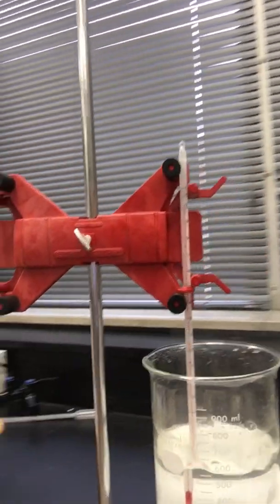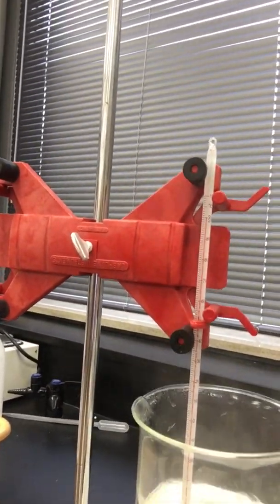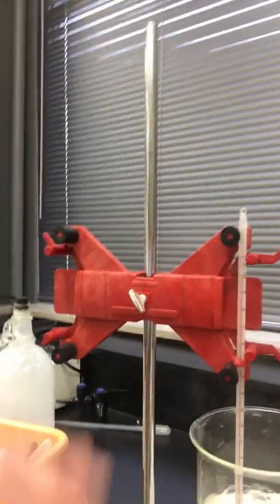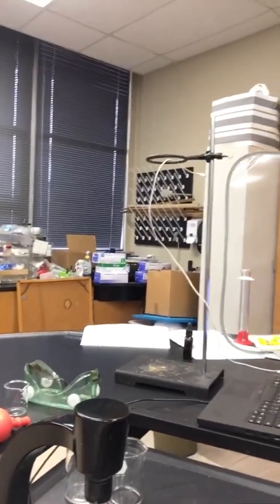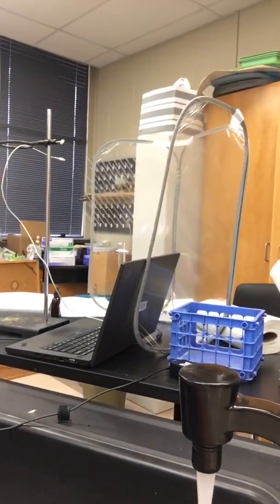So this first one that we'll look at is boiling water, and it looks like it is right at 100 degrees Celsius. And my room is pretty cold, so that boiling water feels pretty good right now. Alright, turn that off so it'll stop boiling. And let's go over here and take a look. We're going to also use hot water from the sink and some cold water, so I'm going to let that run just a little bit.